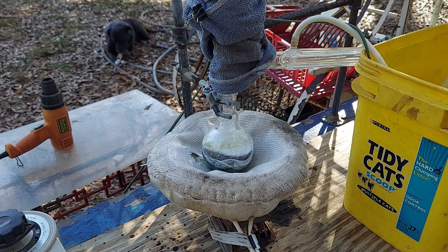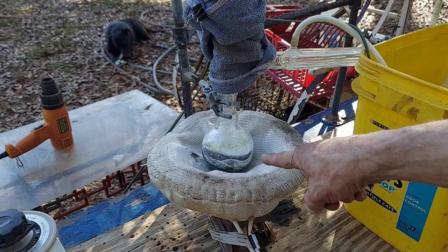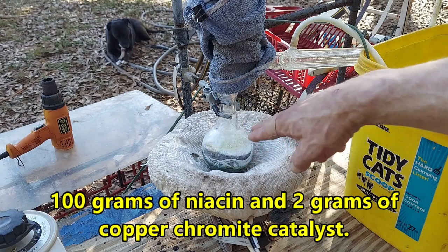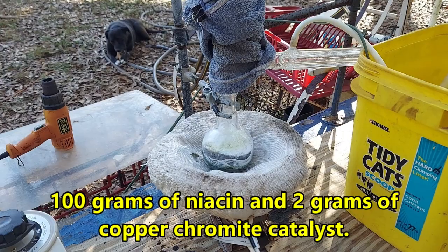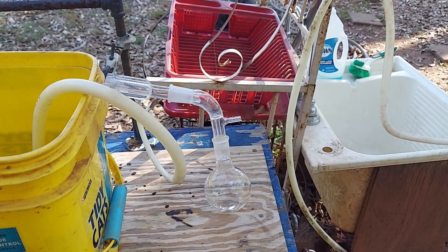I'm beginning to think that they are right, because I went ahead and set up the prep of pyridine exactly like Doug's lab had done it. I can't remember what the amounts are, but they're on the screen now. This is niacin powder and the copper chromite catalyst — heating it up — and lo and behold, we are getting distillate.